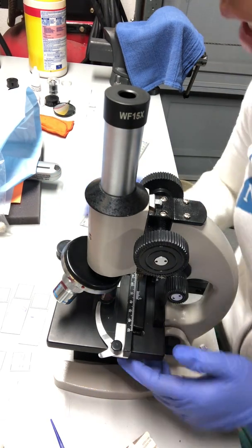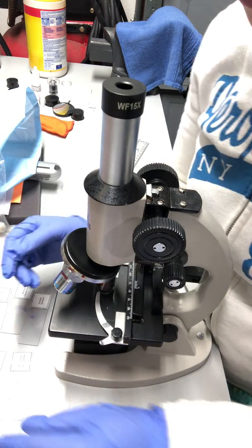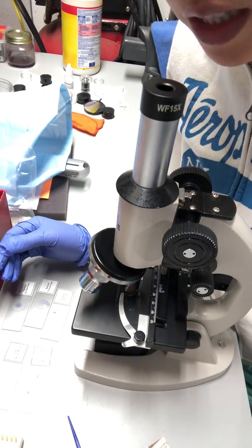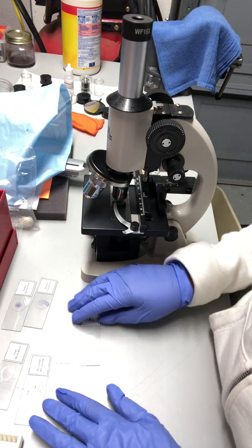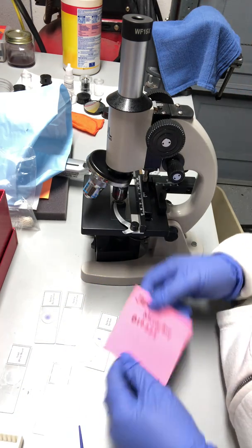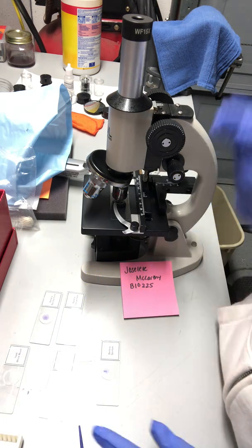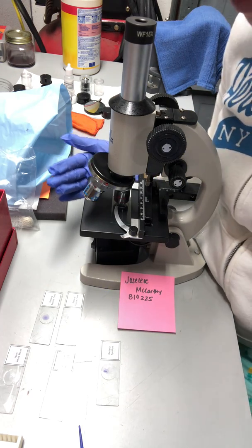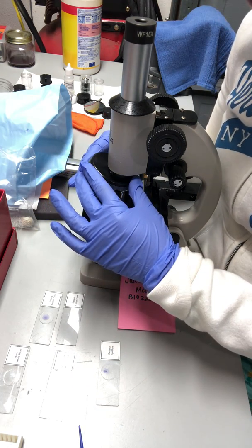And tonight we are asked to try to find, in taking pictures, the different types of slides. And we have different slides here that we were asked to identify on the photographs. As you can see, we have a different bacterium here that we were asked about. So in order for me to identify which one is the best way to show by taking a picture is to change up the different power of the lens.